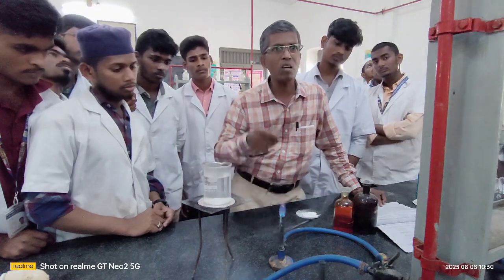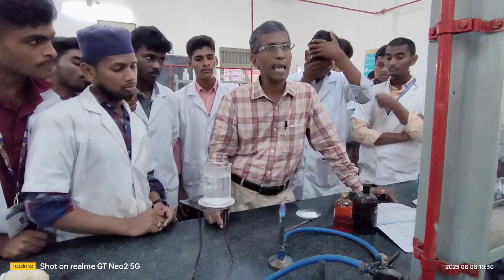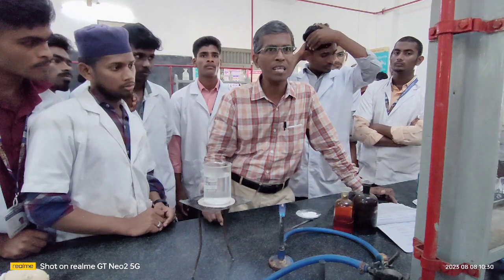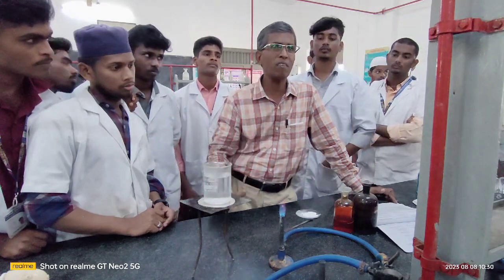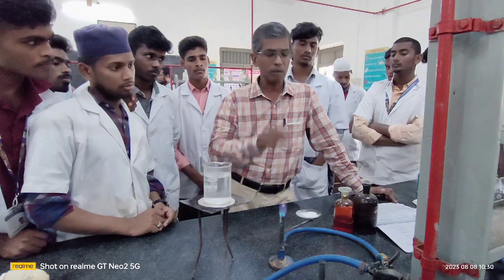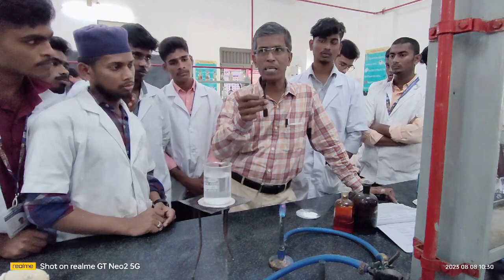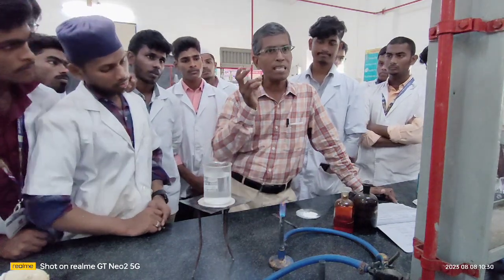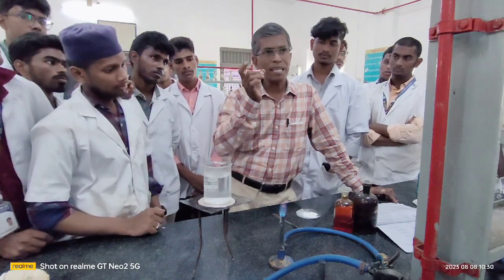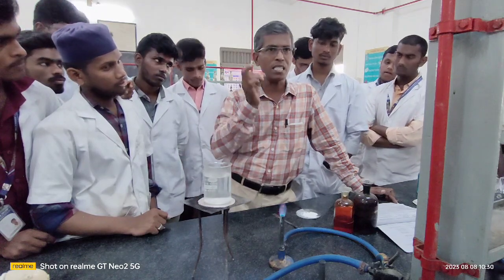So with the help of this, you are confirming the very first point in your analysis. What is the aim of this organic compound analysis? What are the things you are going to confirm? Number one, whether the given compound is aromatic or aliphatic. I showed you how to confirm aromatic or aliphatic. Number two, whether the given compound is saturated or unsaturated. Number three, whether the nitrogen is there or not, that is, whether elements in general are present or not.